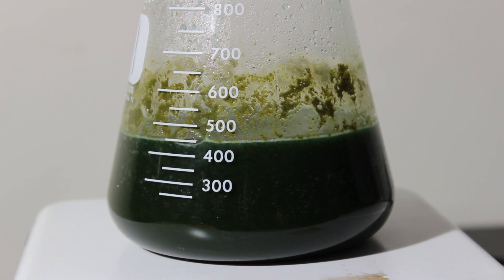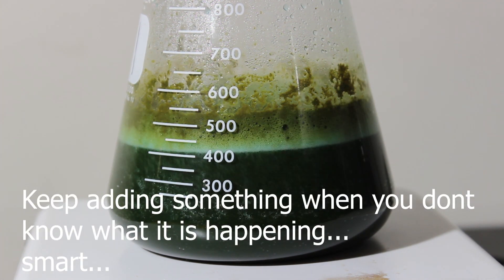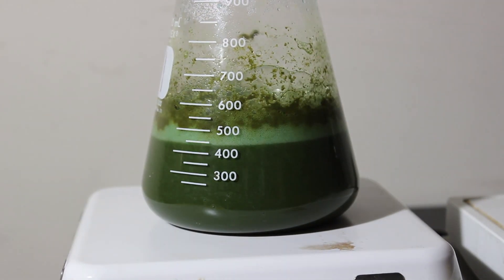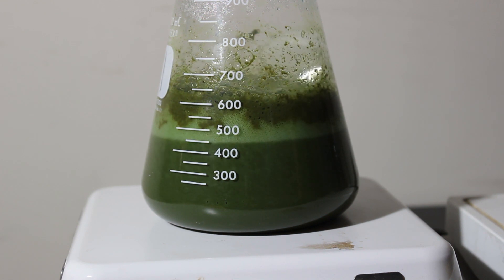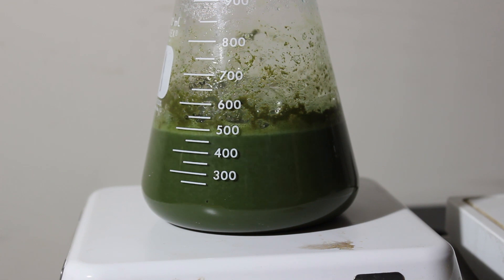That is not the color I was expecting. For some reason it's green — I don't know why it's green, it's like the Incredible Hulk took a dump in the water. That looks awful. Oh well, we're just gonna keep doing what we're doing.